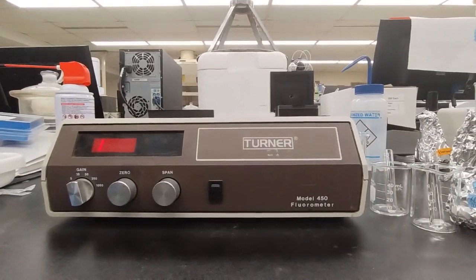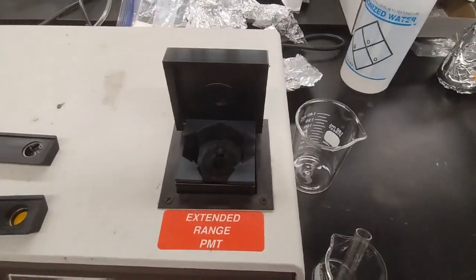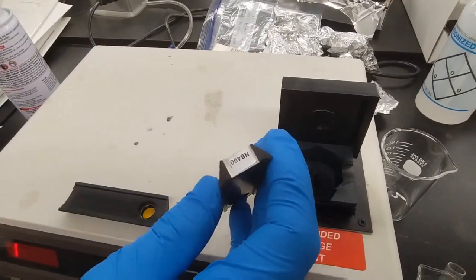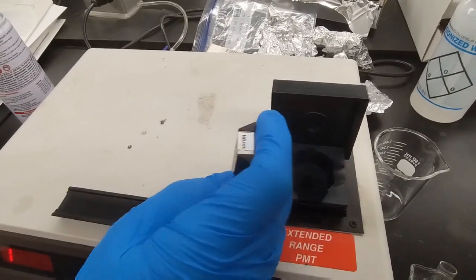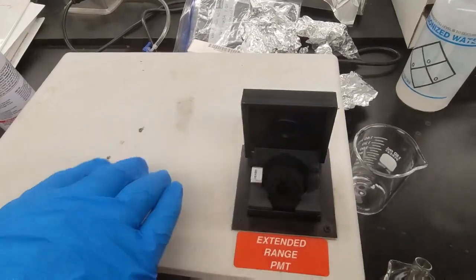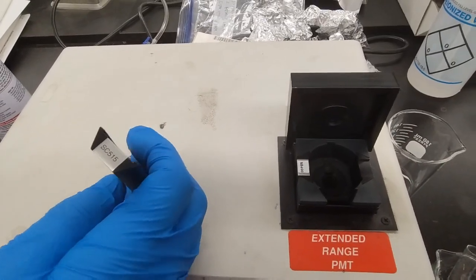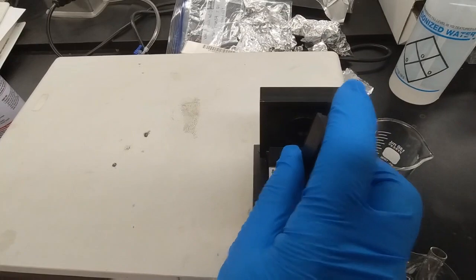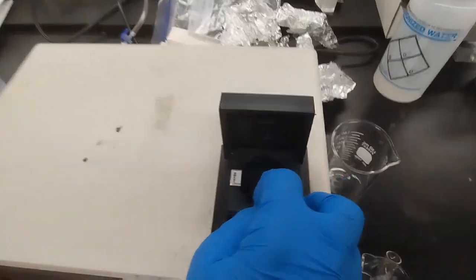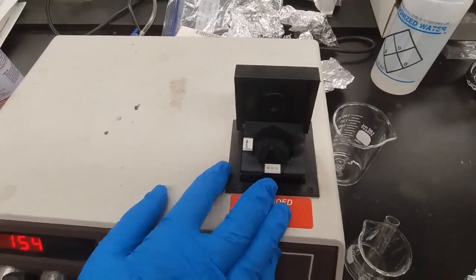Once the 15 minutes are done, this needs to be open, and we'll select and put in the appropriate filters in the sample compartment. The NB filter, in this lab we're using the NB 490, that'll go in the left compartment, just like that. And the SC filter, for this lab we're using the SC 515 filter, that'll go in the compartment closest to you. If the lab needs an aperture slide, that'll just go right in front of either filter, but for this lab we won't need it.